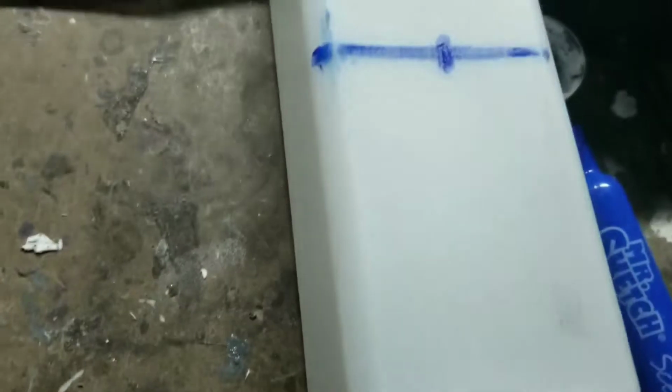Okay, now that that's done, I'm going to use a straight edge to draw a line in between the two dots. Now that this line is drawn, I'm going to measure the exact middle of the line. Okay, the exact middle of the line turned out to be 1.25 inches. So that's good. Now I am going to take this bottle and remove the label, because this is going to be the center part of the electrolysis rig.